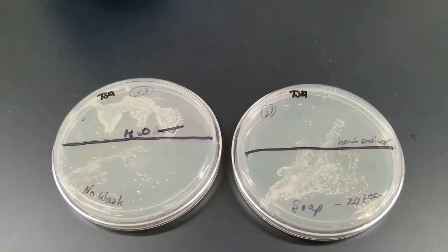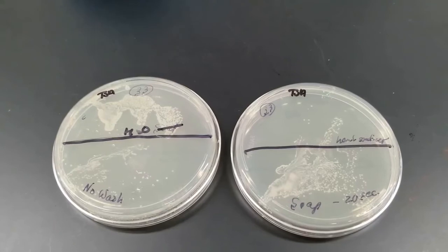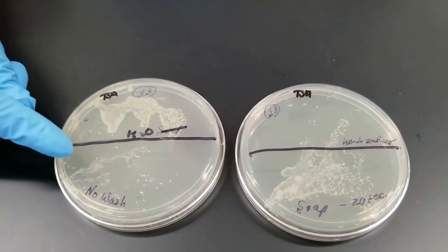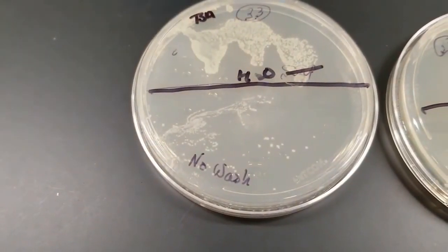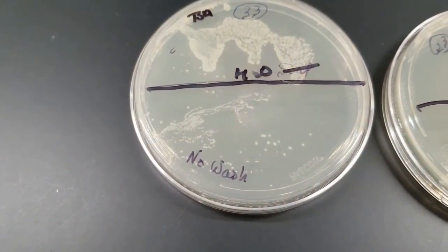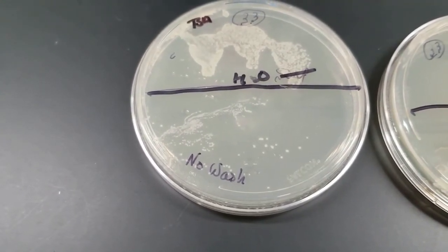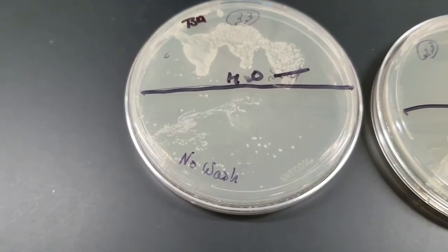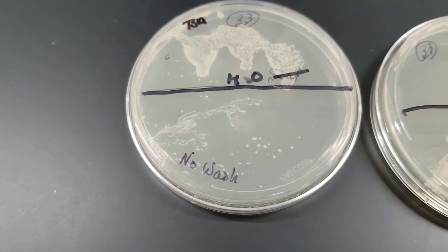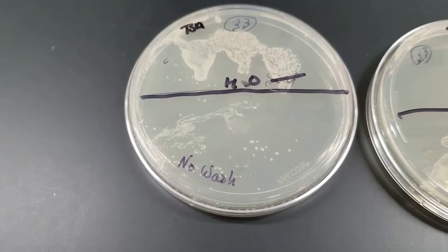So we have 4 different spots on the plates that we inoculated. I use my 3 middle fingers to touch the plate. We start over here on the bottom. That is where I just touched it with my fingertips without washing my hands at all. Now, one thing I want to say is when I did this, I had been working in the lab all day, but I had had gloves on. So touching things around the lab, around my environment, I had not had direct contact because I had the gloves on. So that could explain why the numbers are kind of low on there.